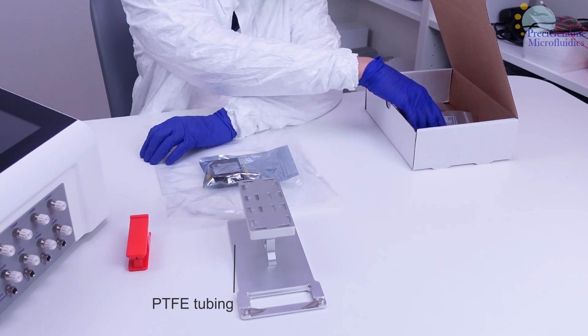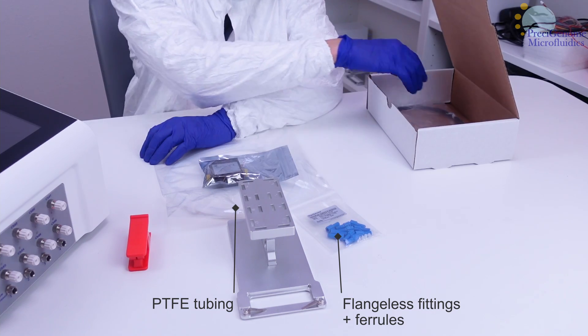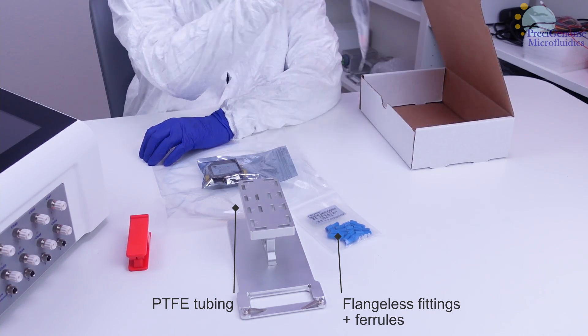You will need PTFE tubing, flangeless fittings and ferrules, the flow sensor itself and its power cord.